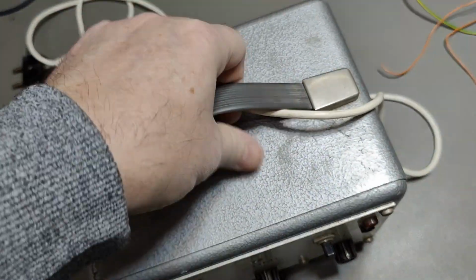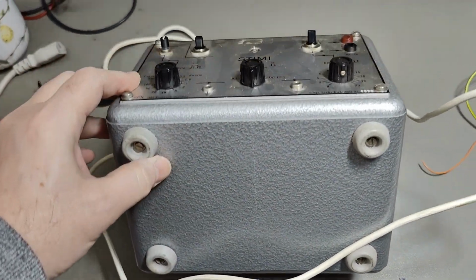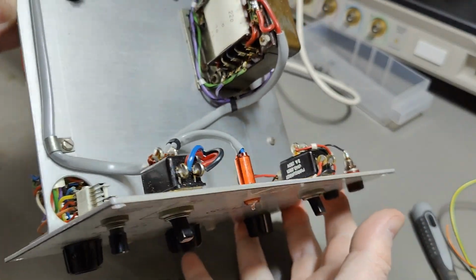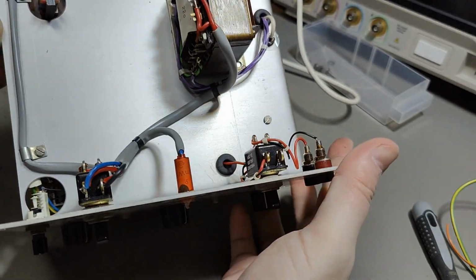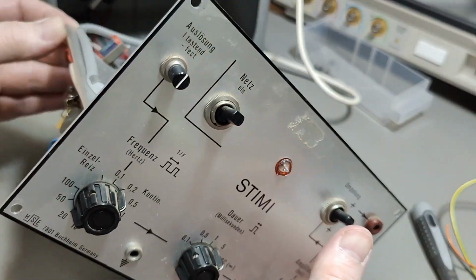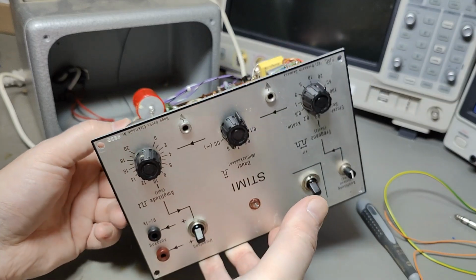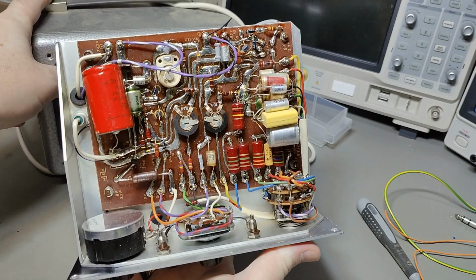How are we going to open this? I mean, I only see those four screws, so it has to be that, right? So that was easy. Yes, it was definitely just those four screws, and then I pulled it out. And there's not a lot of electronics inside here, on the top at least. It's nice and clean and all that. So let's look at the bottom. What I call the bottom side of the unit. Here you go. I should probably go a little bit closer.